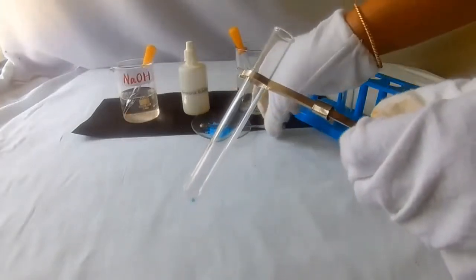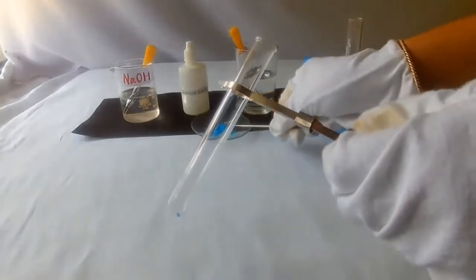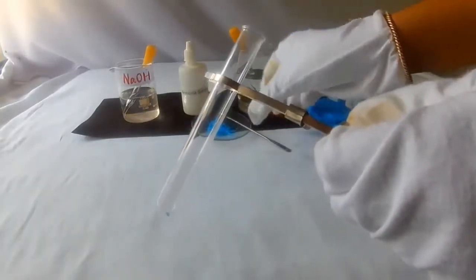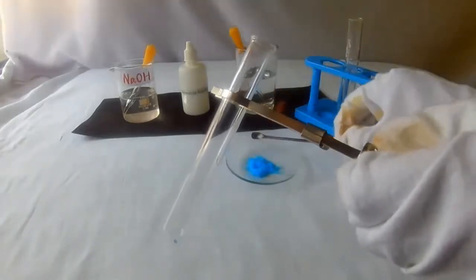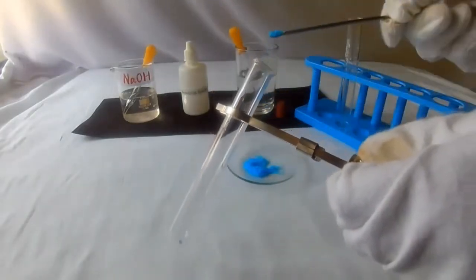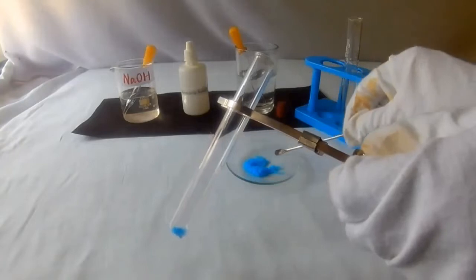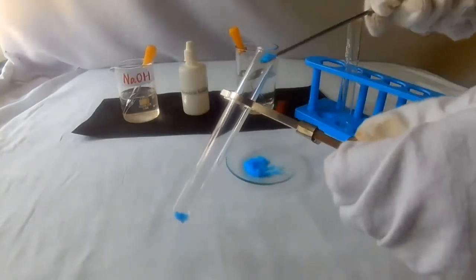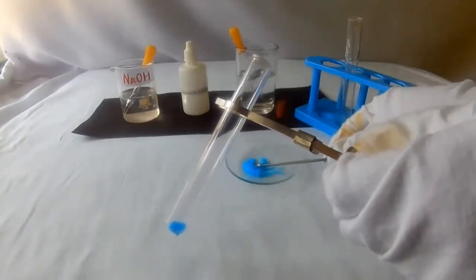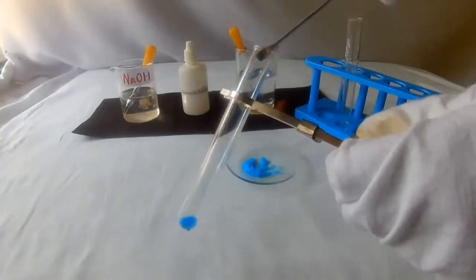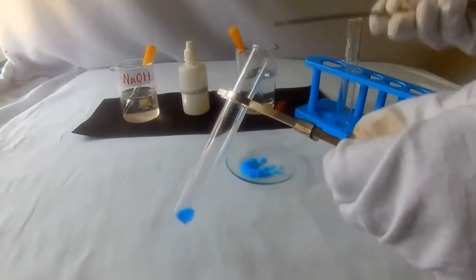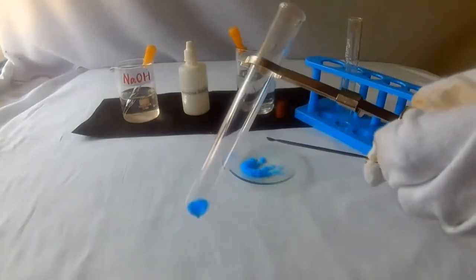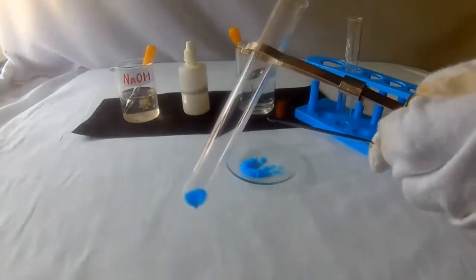Take a test tube. Add the copper sulfate salt into the test tube. Do it carefully.